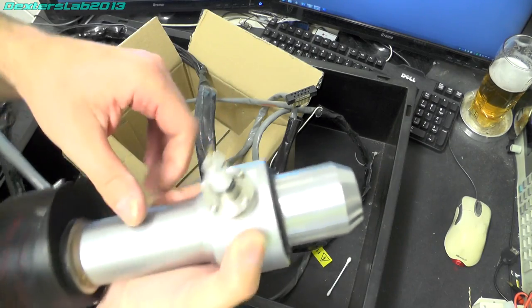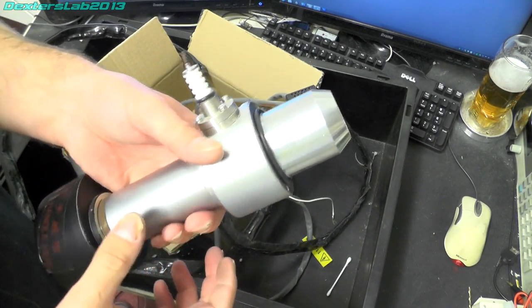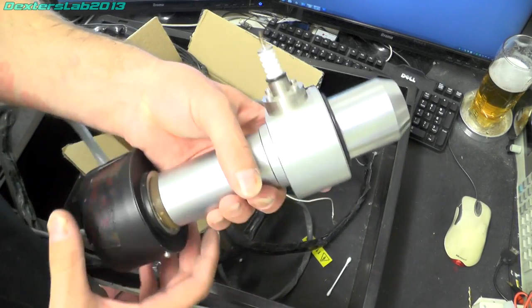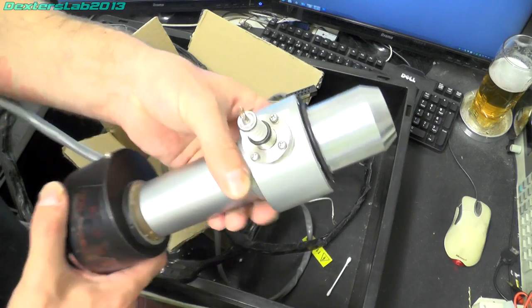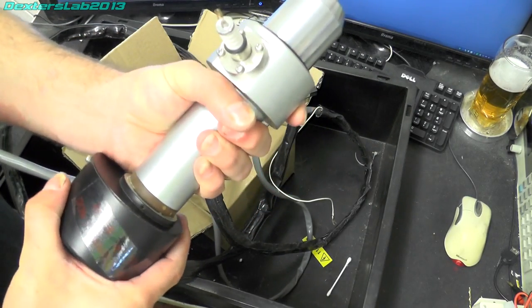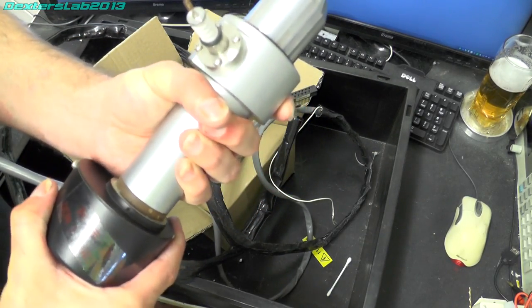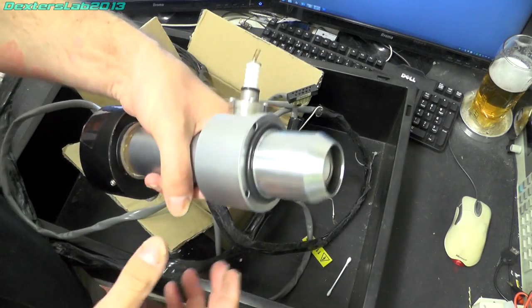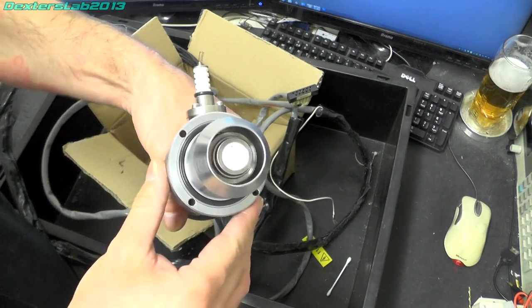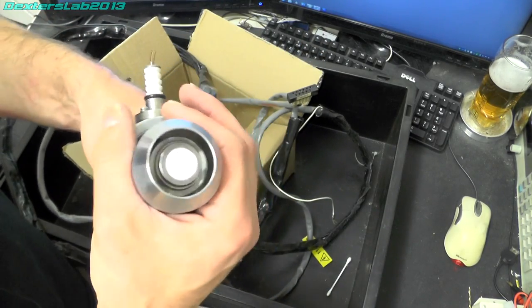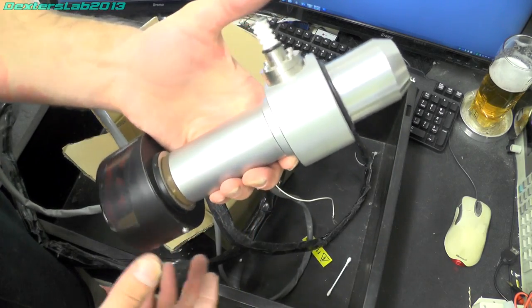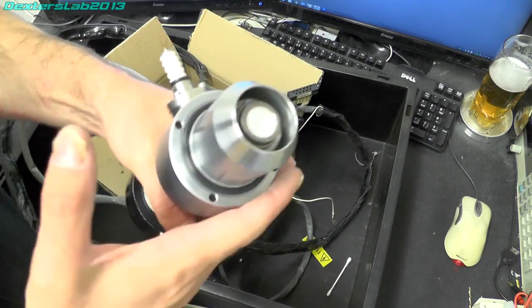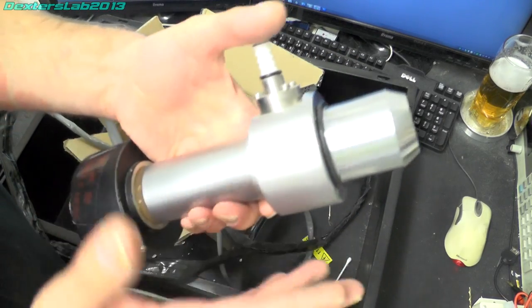Unfortunately it did look like this electron microscope had been somewhat abused and maybe left and sat in a corner unloved and slowly got damaged. Because there were a few little bits missing, not in the right place or slightly damaged. There we go, so hopefully somebody can make use of this.